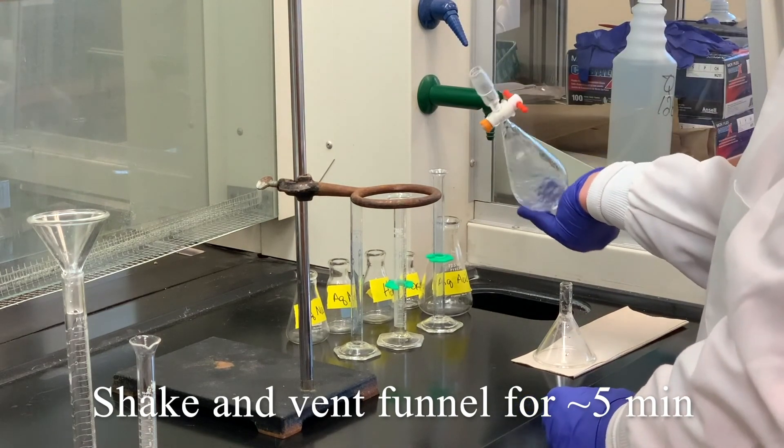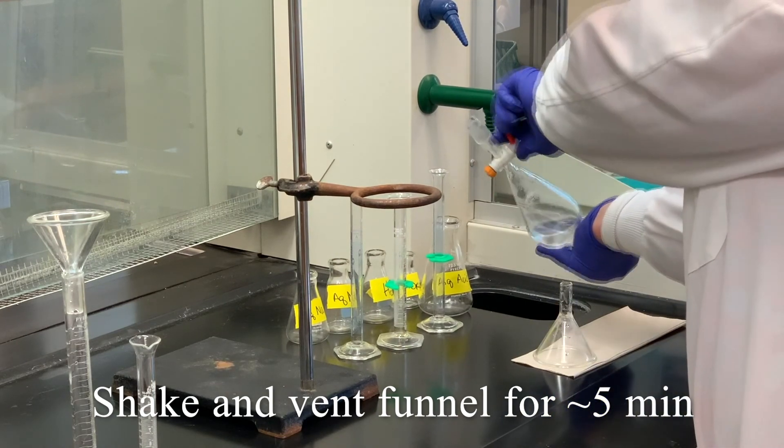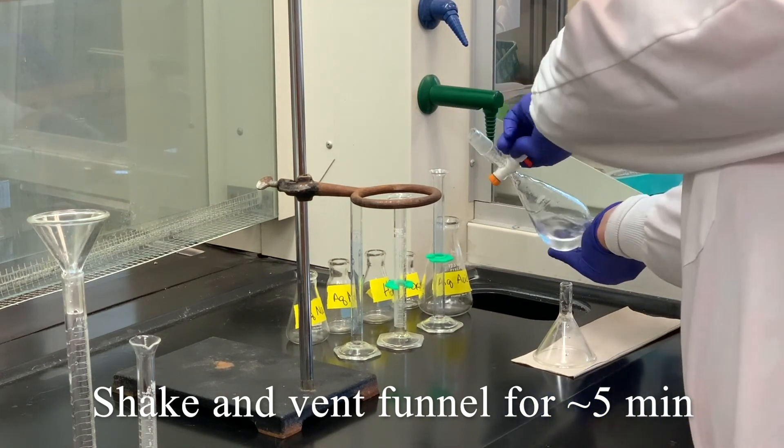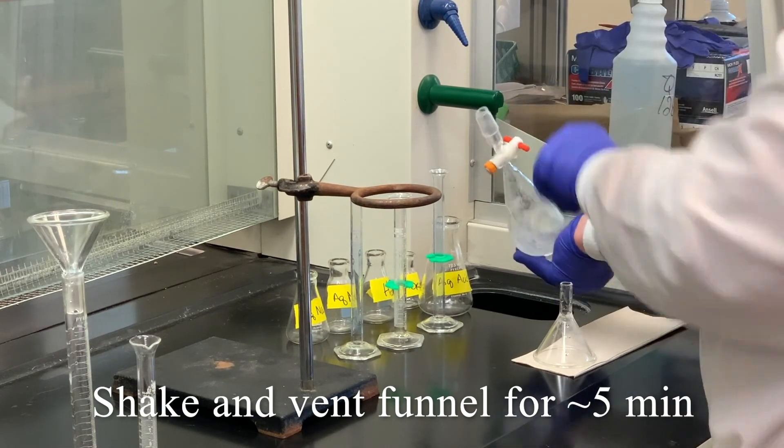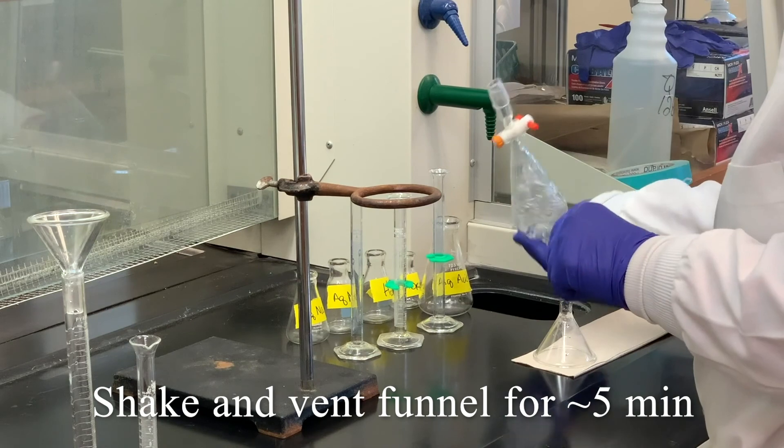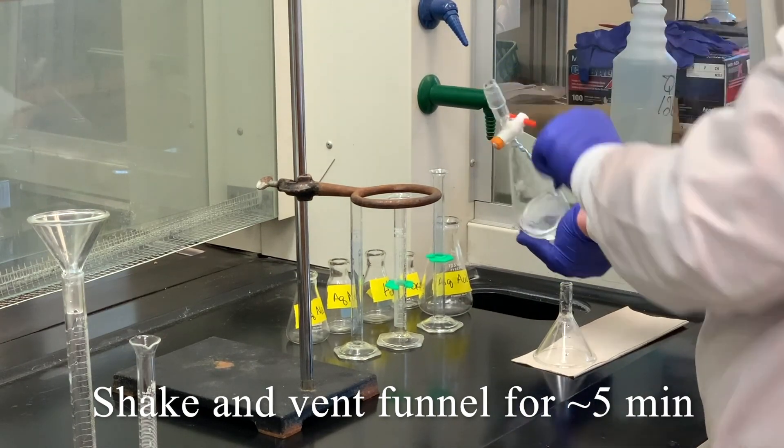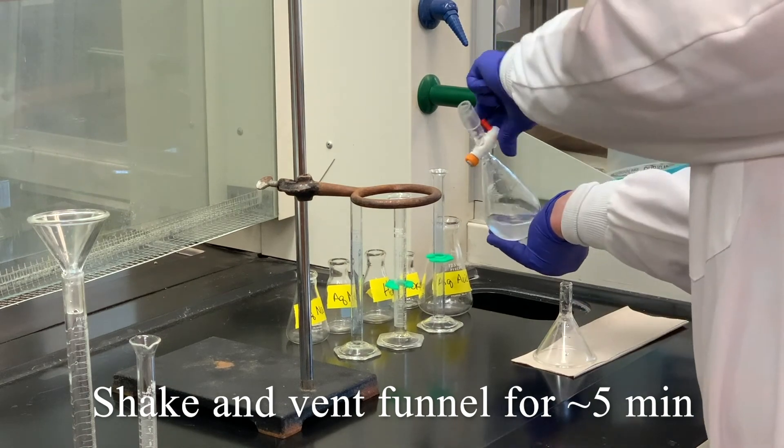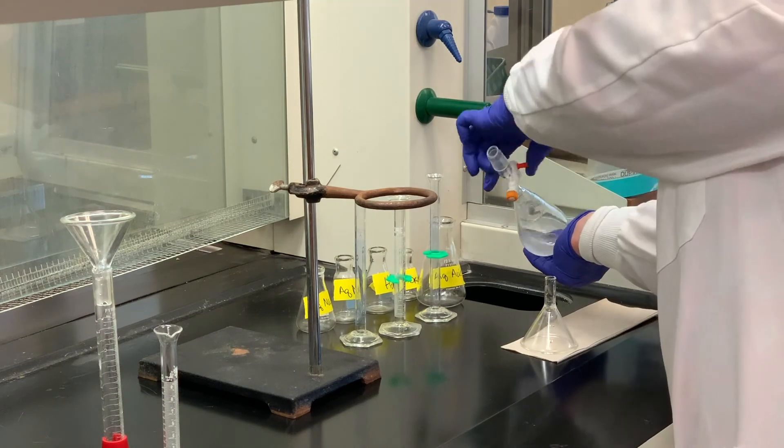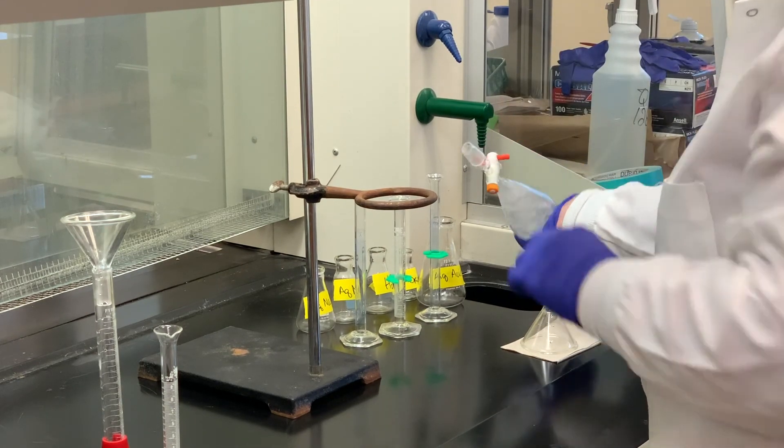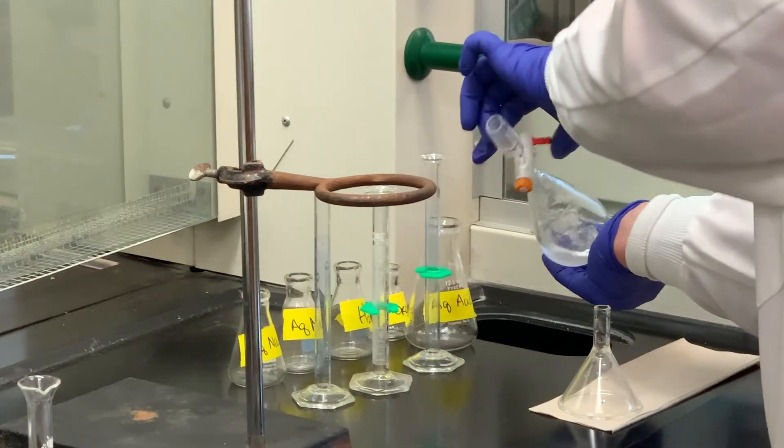And now what I need to do is just kind of shake it for about five minutes, venting in between.